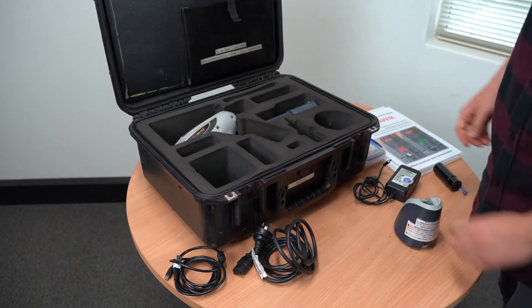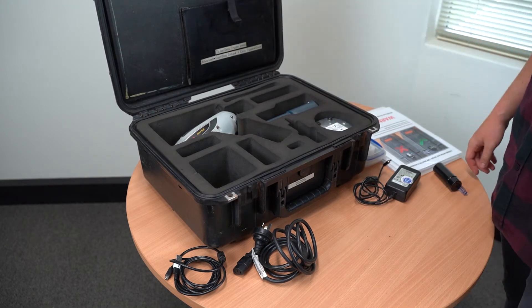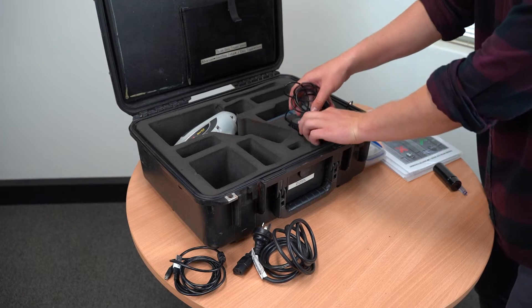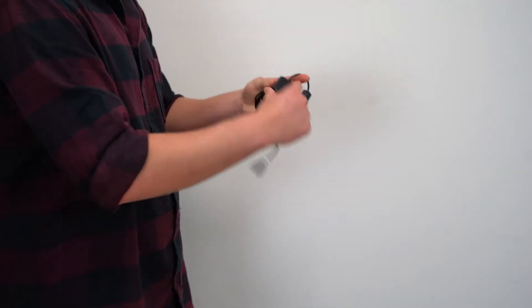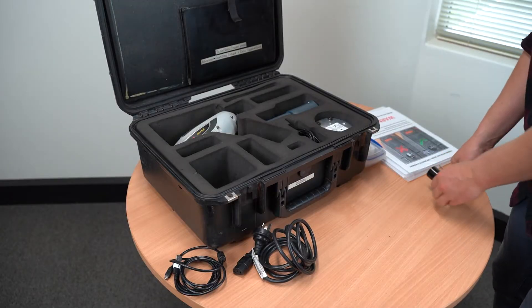The best place to start is the battery charger. Turn it upside down and place it into its designated slot. The rectangular charging cable can be put into the slot directly next to it. The trick we like to do is roll them up like this — not super tight and the ends not bent on the power pack, so the cords will last longer.